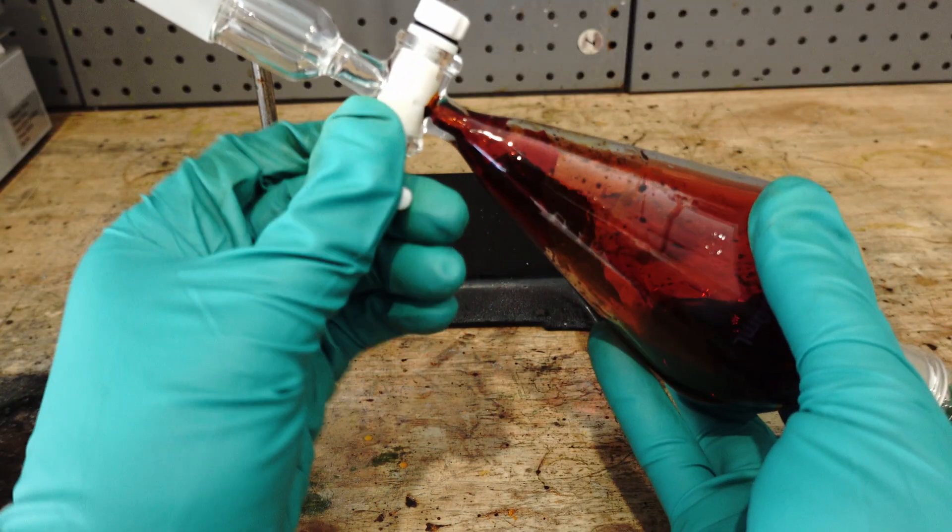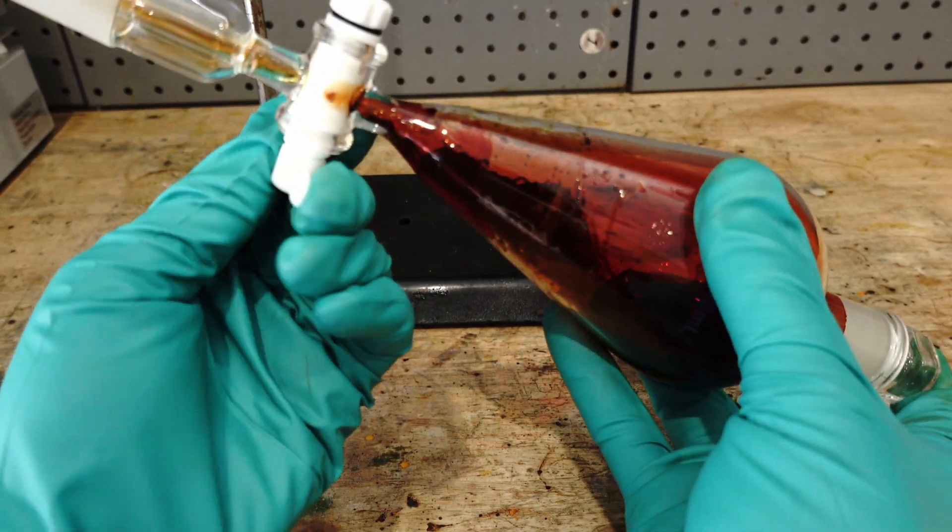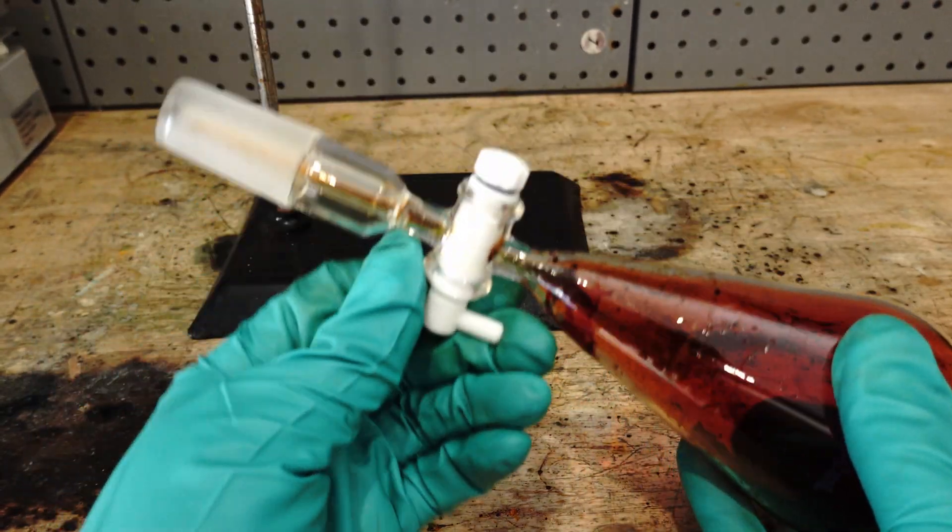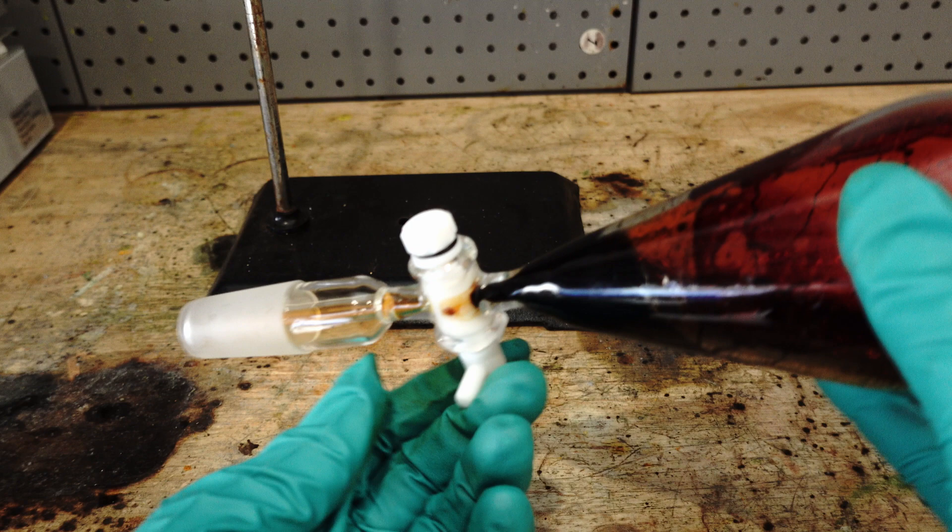The two chemicals are shook and vented a few times. Venting is important, as if we do not vent, the pressure build up in the flask may explode, causing some terrible burns. Trust me, I know from experience.